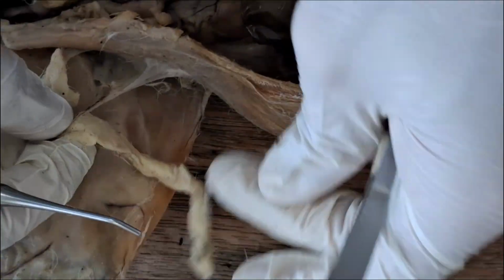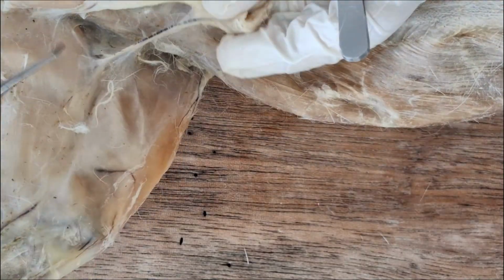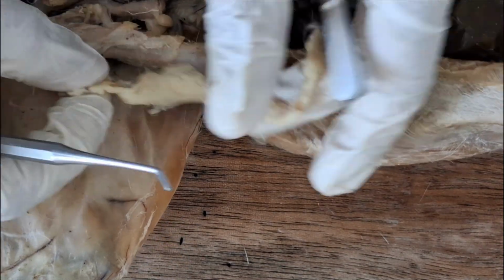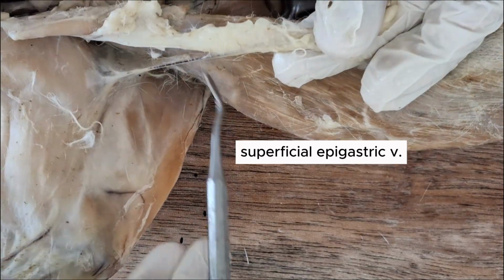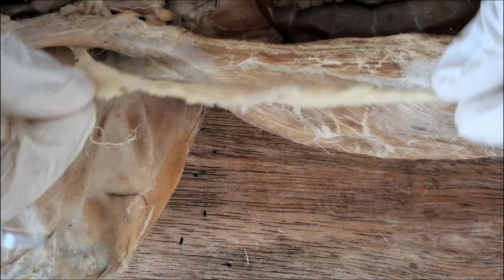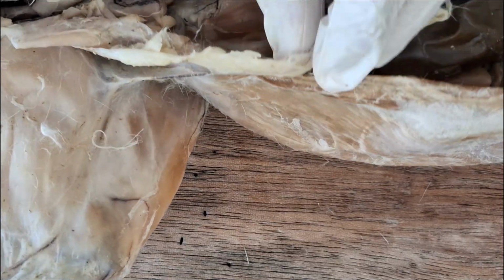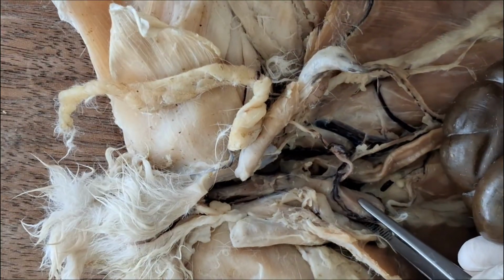So that vein was already seen during the skinning process. It's that vein located on the groin area, adjacent or sticking to the fat in the groin area. So this is the superficial epigastric vein. So if you haven't removed some of the fat in the groin, in the inguinal area, you should see this vein, which is the superficial epigastric vein. This one is also draining into the external iliac.